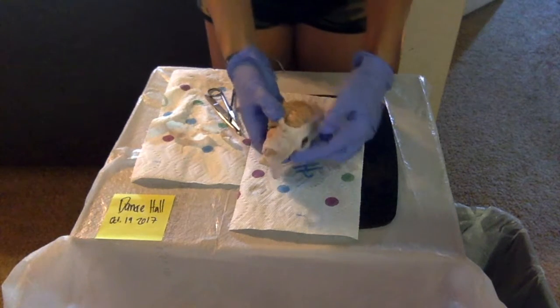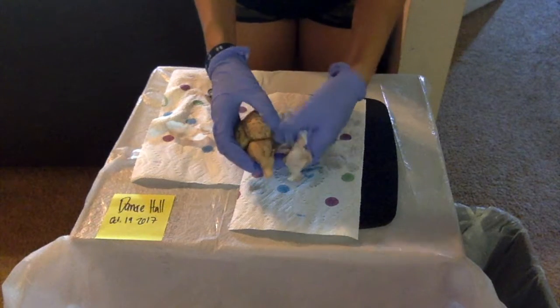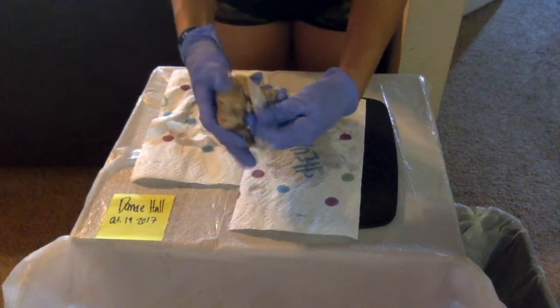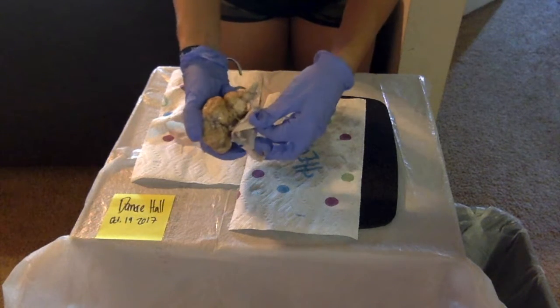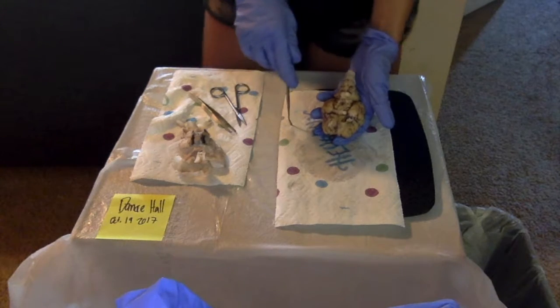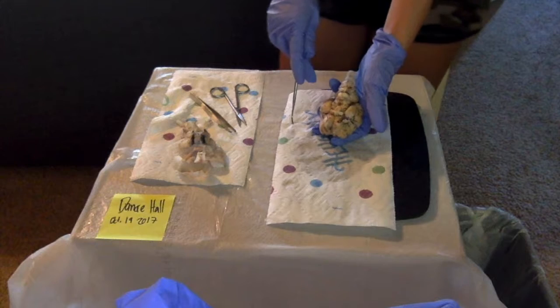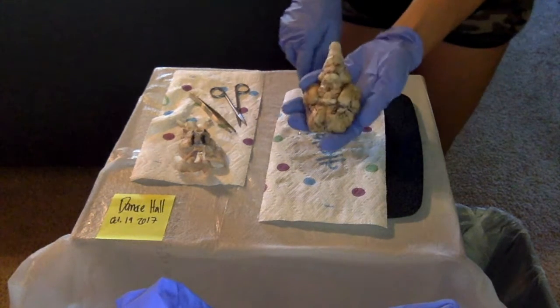So as you can see, I have most of the meninges off. It just is peeling off at this point, and I just have to get it off of this back part right here. So all this comes off pretty easy though. So now that we can see the entire brain, we are going to point out some of the key structures that are on this half of the brain first, and then we'll go to the next half.